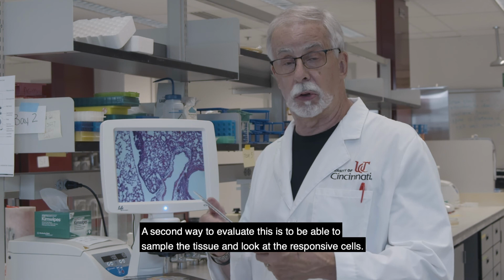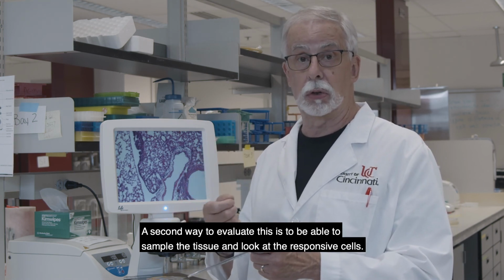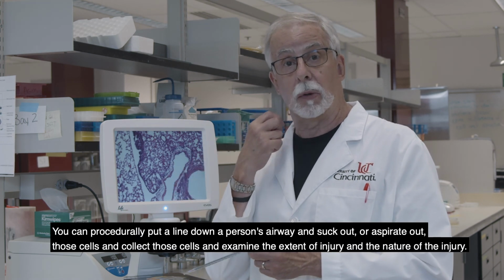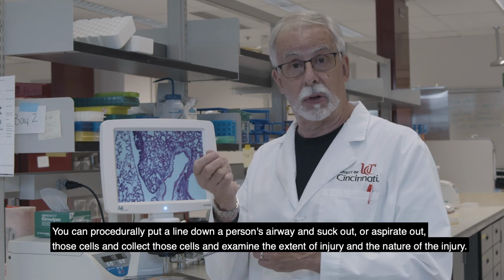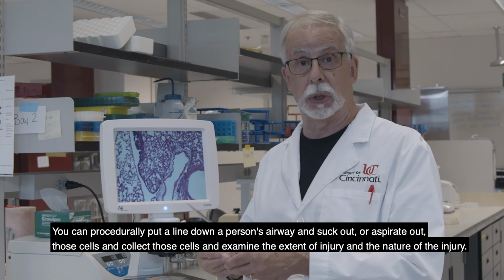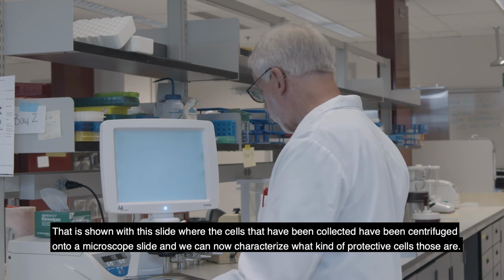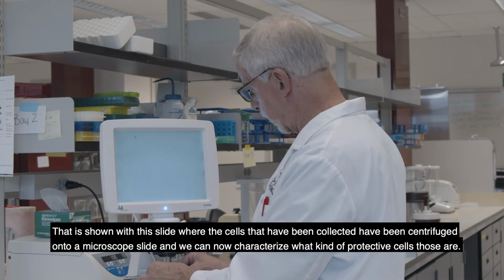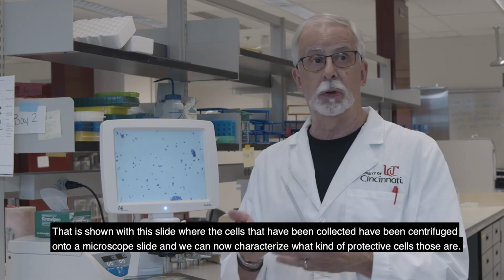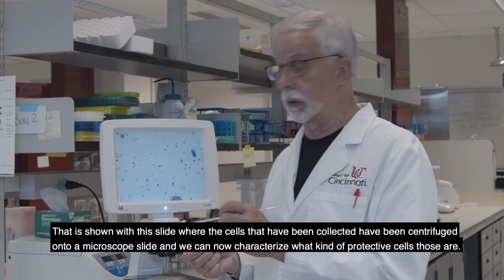The second way to evaluate this is to be able to sample the tissue and look at the responsive cells. So you can procedurally put a line down a person's airway and suck out or aspirate out those cells and collect those cells and examine the extent of injury and the nature of the injury. That is shown with this slide, where the cells that have been collected have been centrifuged onto a microscope slide, and we can now characterize what kind of protective cells those are.